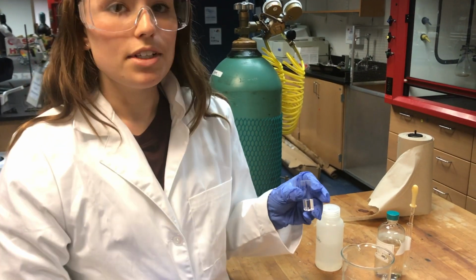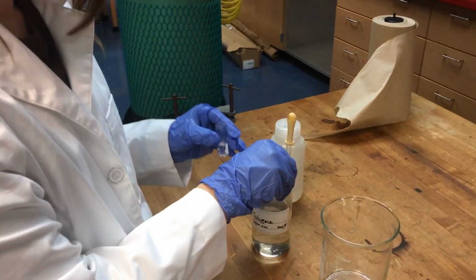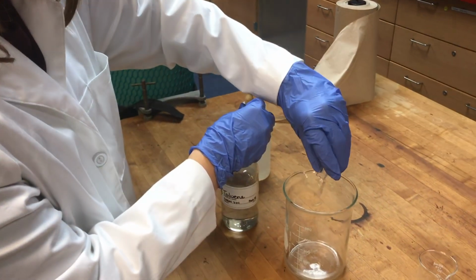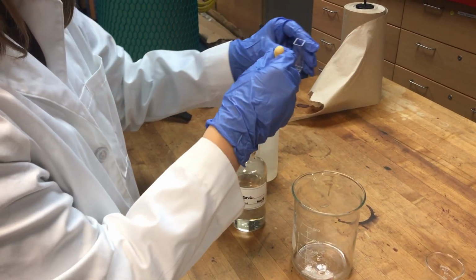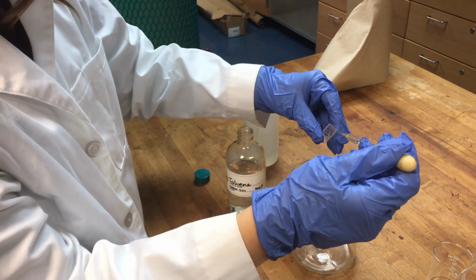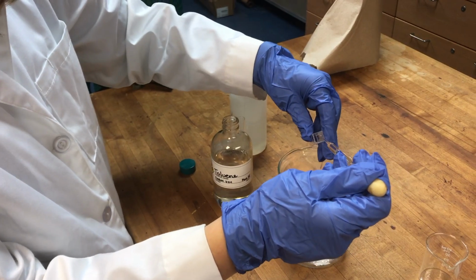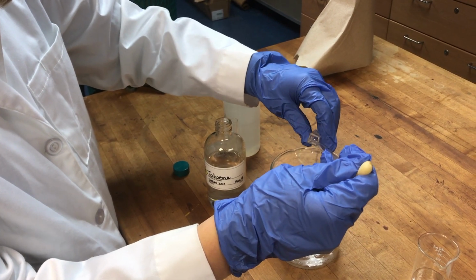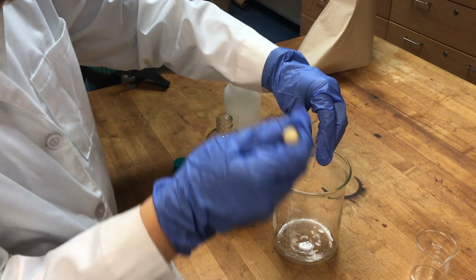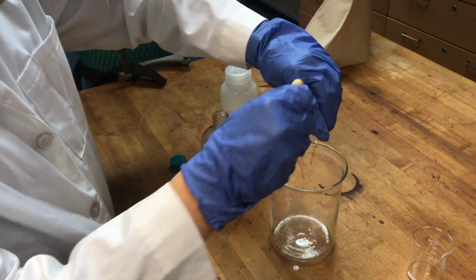Once you're done with your sample, to clean it, you're going to take the same solvent that you used to dissolve your material and rinse it out into a waste beaker. So you can dump out the original, and then take a glass pipette, making sure not to touch the sides because it can scratch really easily. Take the same solvent, in this case toluene, and rinse out the inside of the cuvette. You want to do this about 3 times, and it should be good.